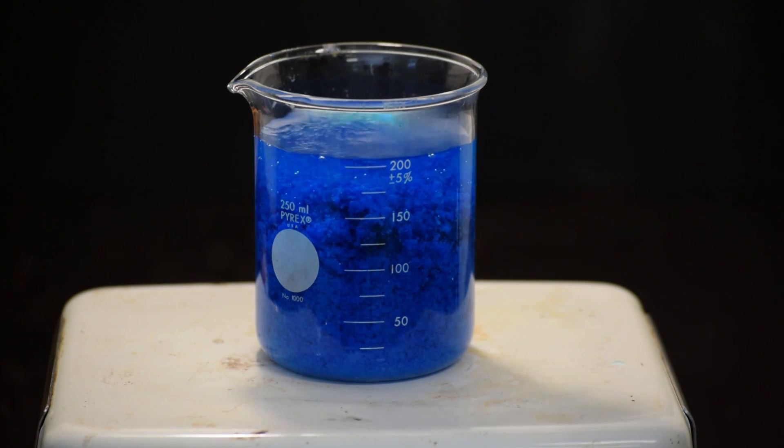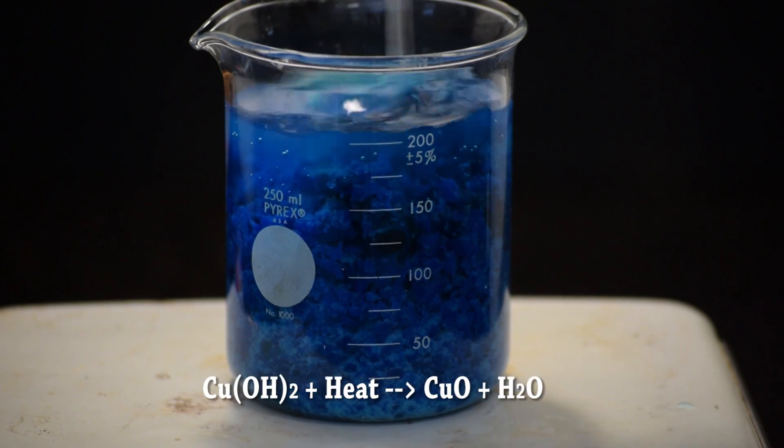Next, begin to heat this copper hydroxide. This will decompose it into copper oxide, which is black.